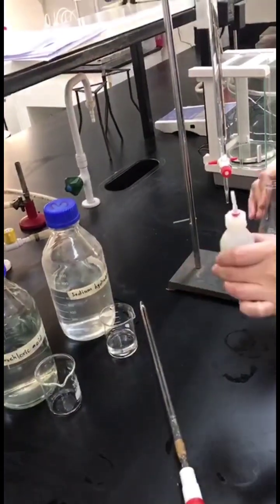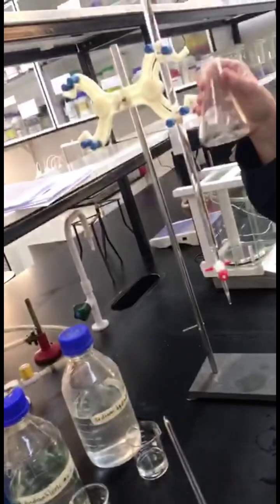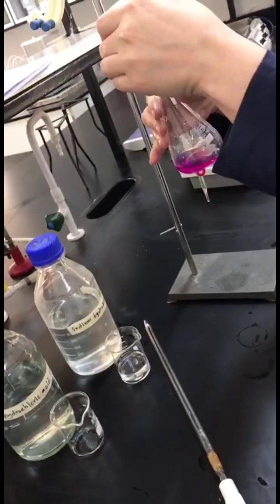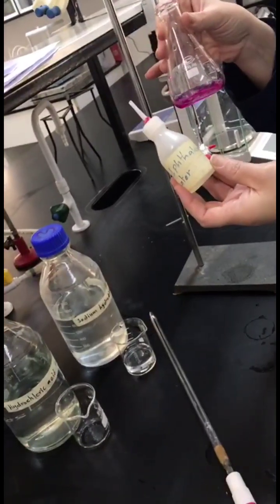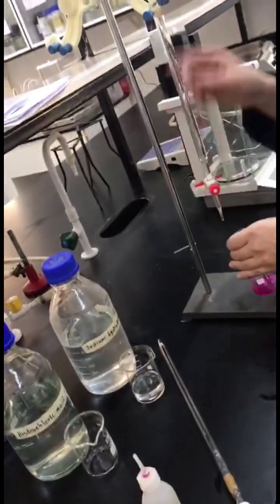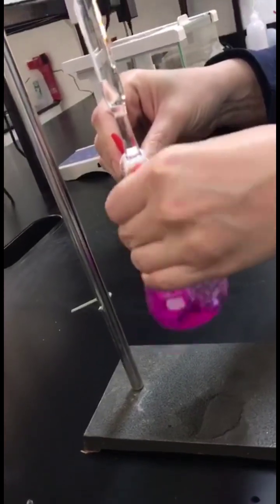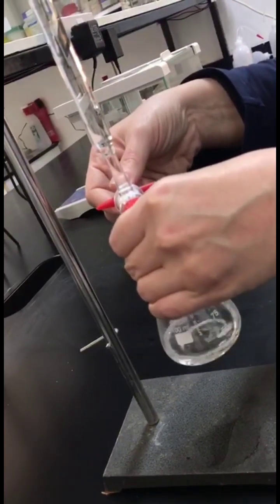Part B of our practical experiment, we are going to react the NaOH with the HCl. We put 10 ml of NaOH in the Erlenmeyer flask. We will add 3 drops of phenolphthalein indicator. Look, as we said before, phenolphthalein indicator under basic condition becomes pink to violet. Now we will start our titration of NaOH with HCl. The color must be diluted until it disappears.